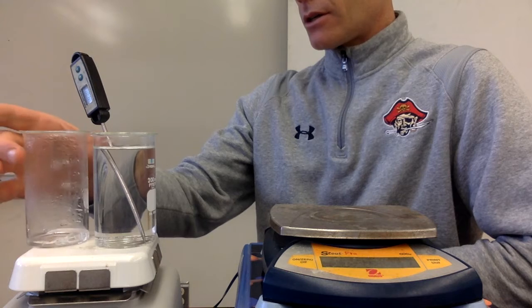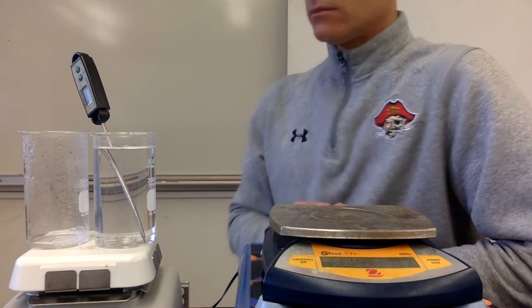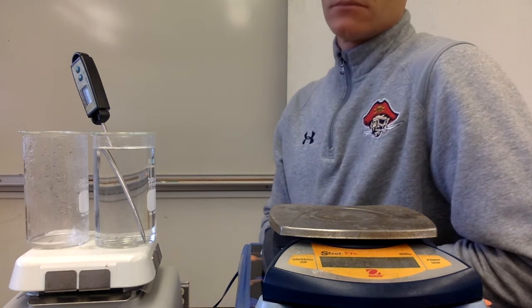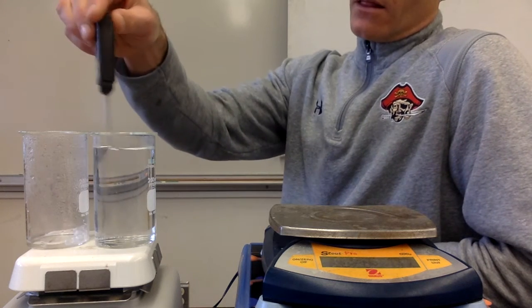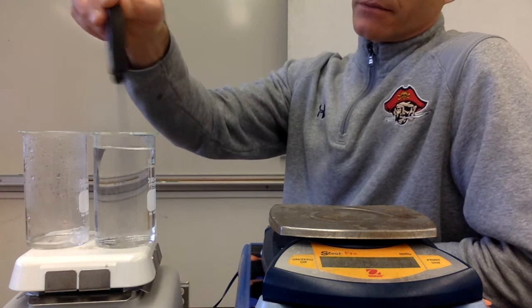All right, we're almost done. This water is just about gone. This water has gone up to 46.3 degrees.